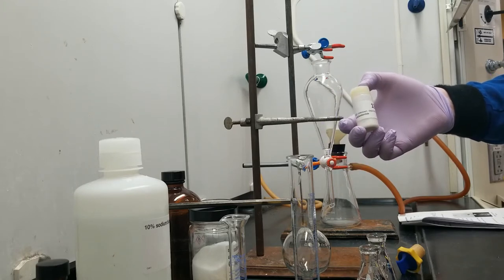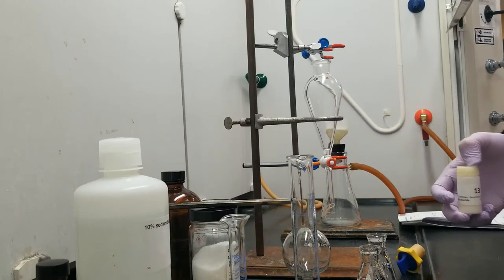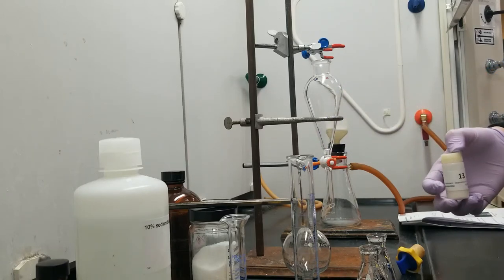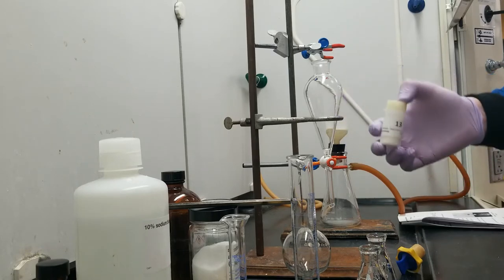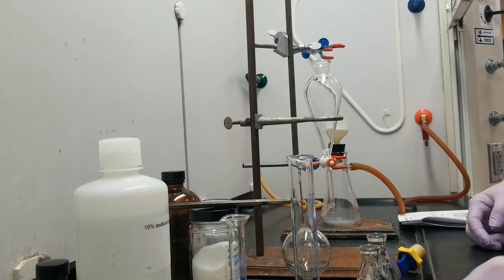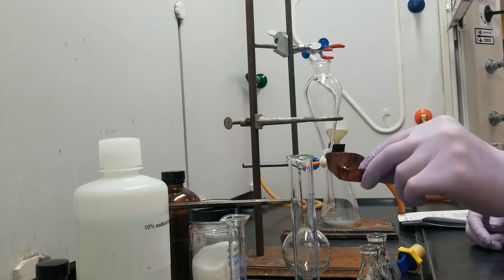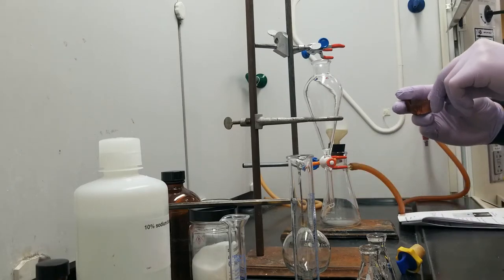In order to separate these away from each other, I'm going to use the removable proton on the 3-chlorobenzoic acid to transfer it to an aqueous layer. Let's get started with that. I've already measured out one gram of my mixture here, which is going to go into a sep funnel.